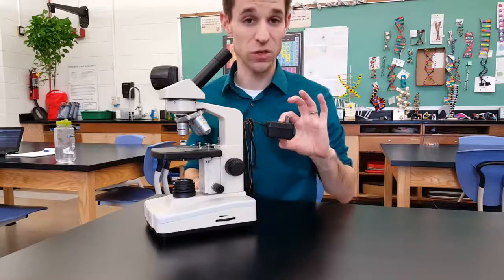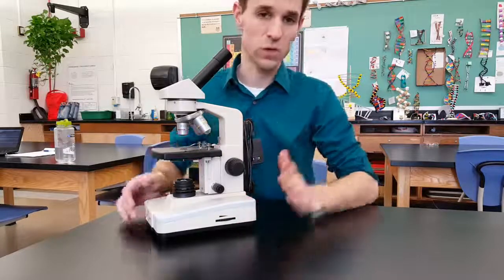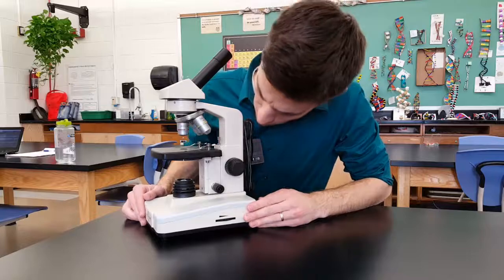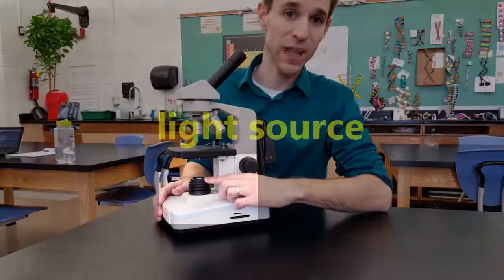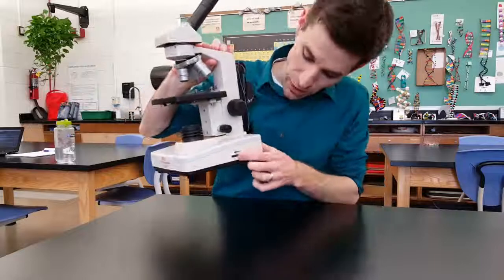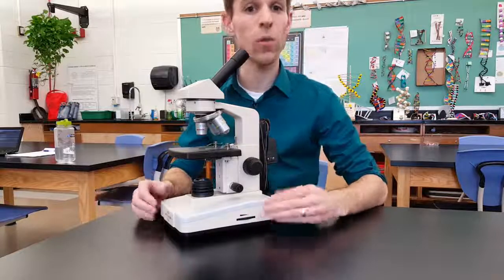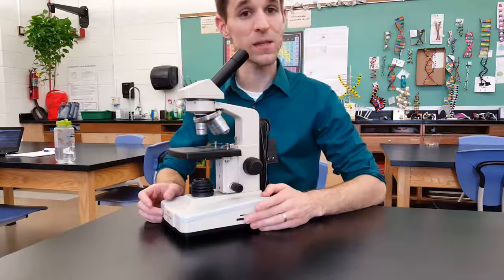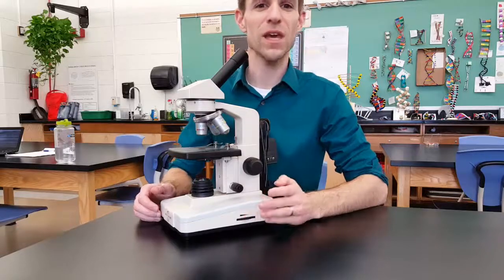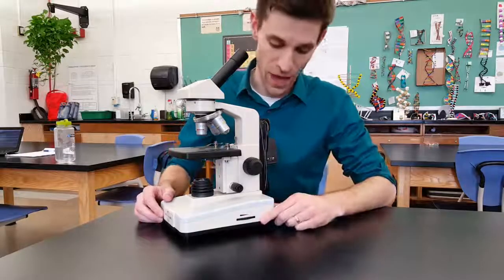There's a plug-in here — this is an electric scope. Most of our student scopes are rechargeable, so you can use them on the table without plugging in. But if you ever lose power, you can plug it in, and we usually plug it in at the end of the day to make sure we have enough power for the next day. The scope has an LED light down here. This light is very bright and it's controlled by a knob down here — turning it one way brightens the light, the other way dims it. Depending on what you're looking at, you might want a bright or dim light. At high magnification with a very bright light, you can really hurt your eyes, so be careful. If it's hard to see your specimen, you probably need more light.